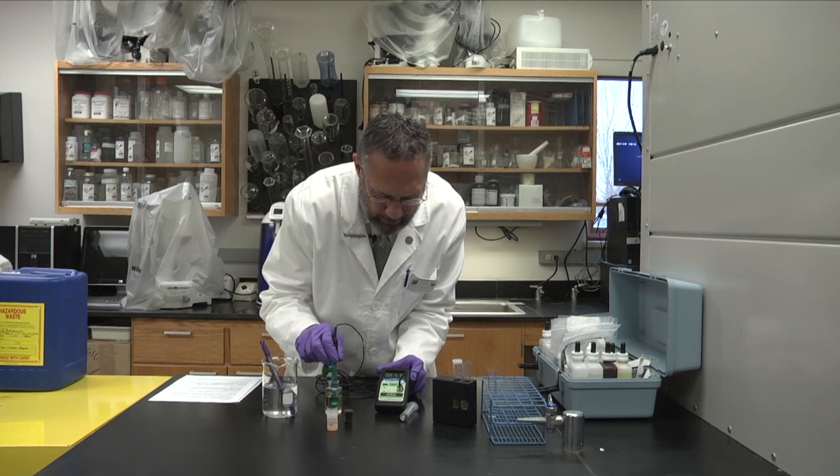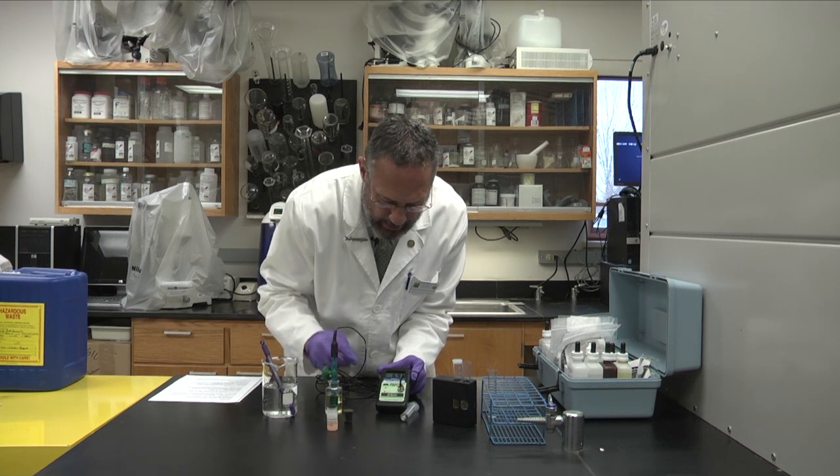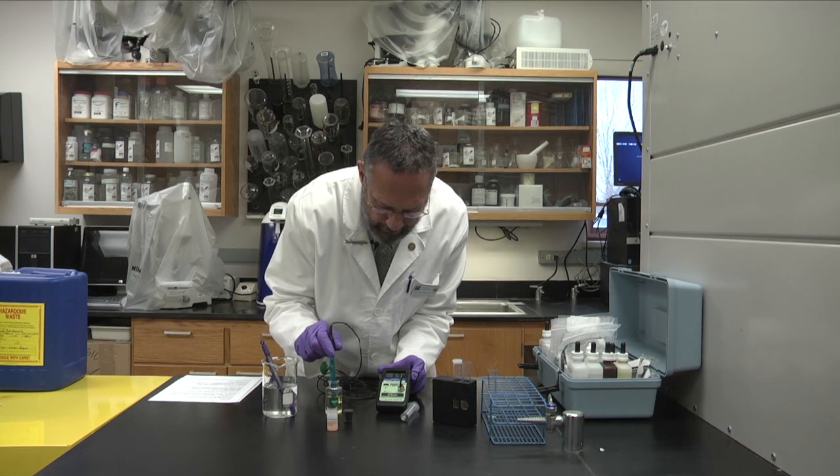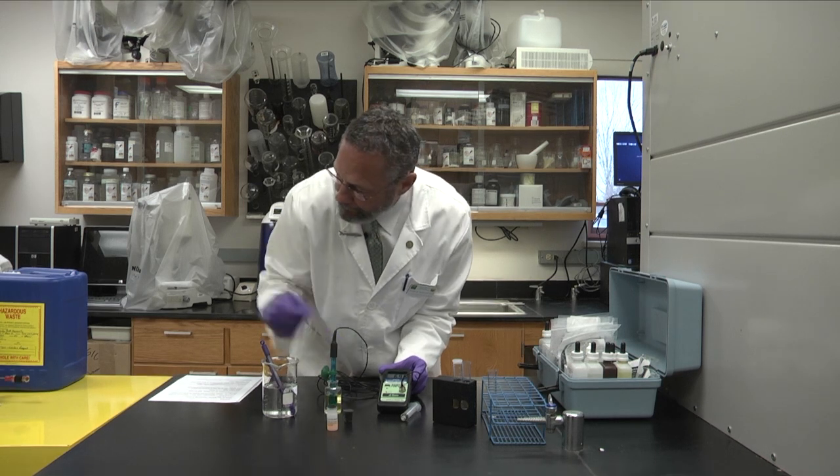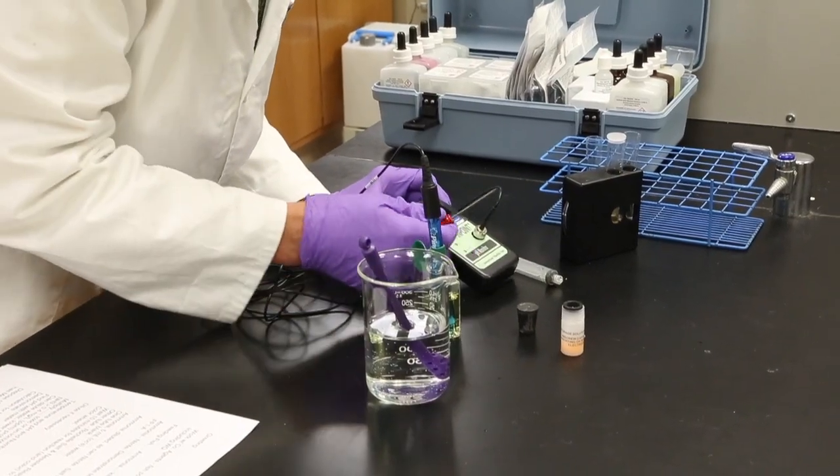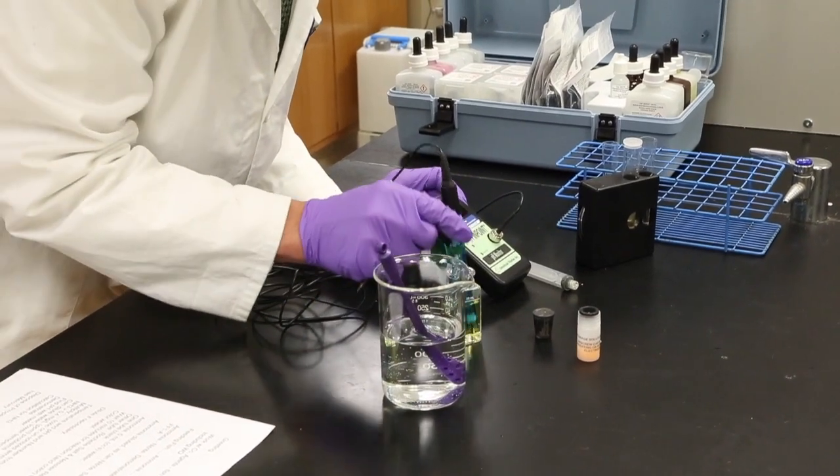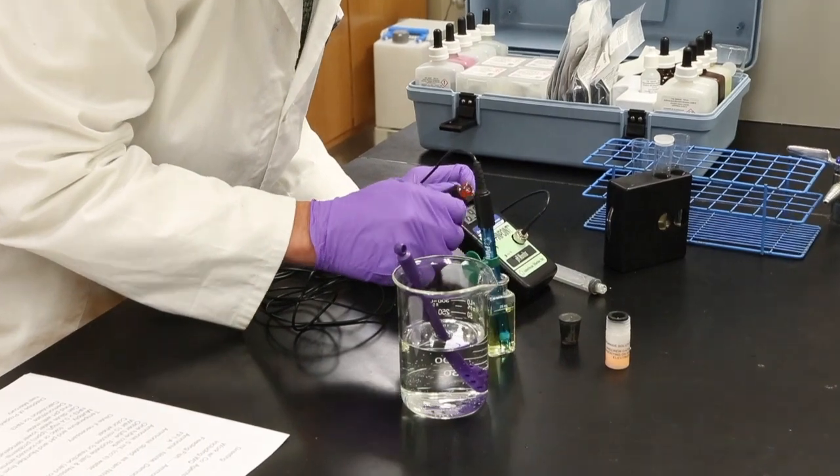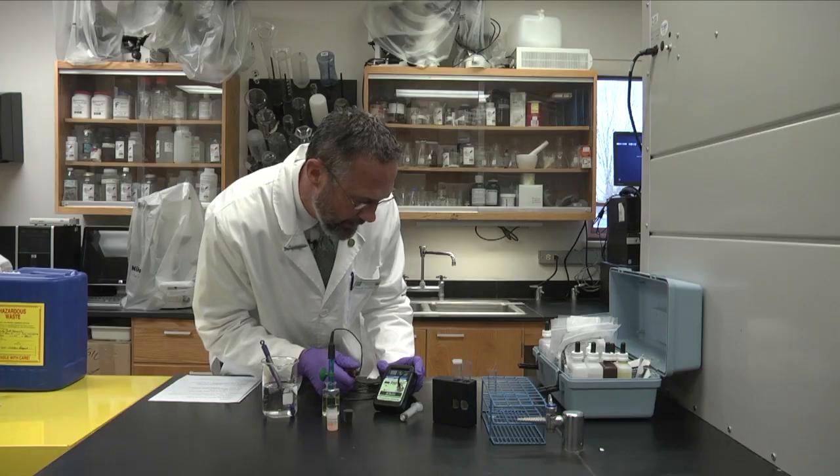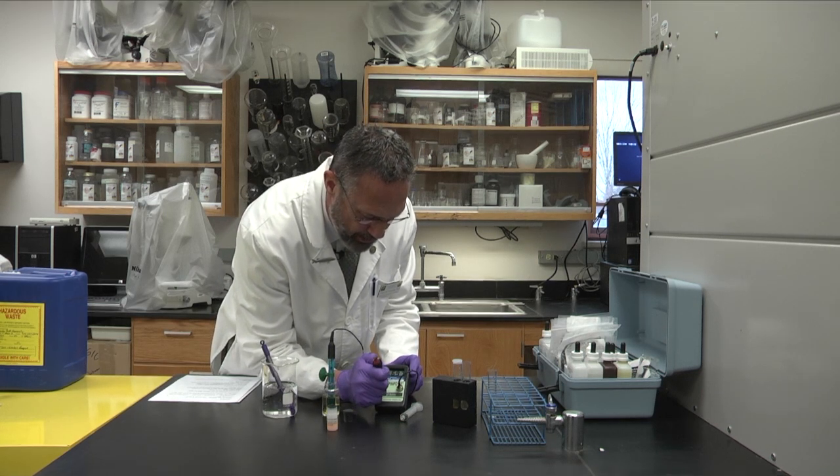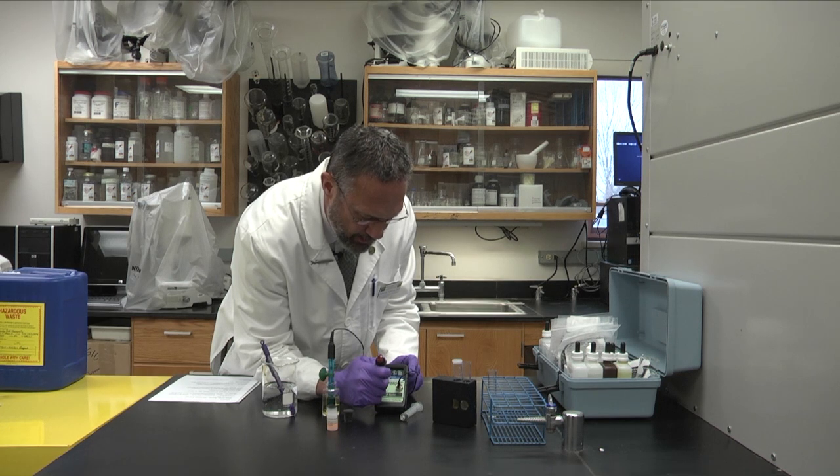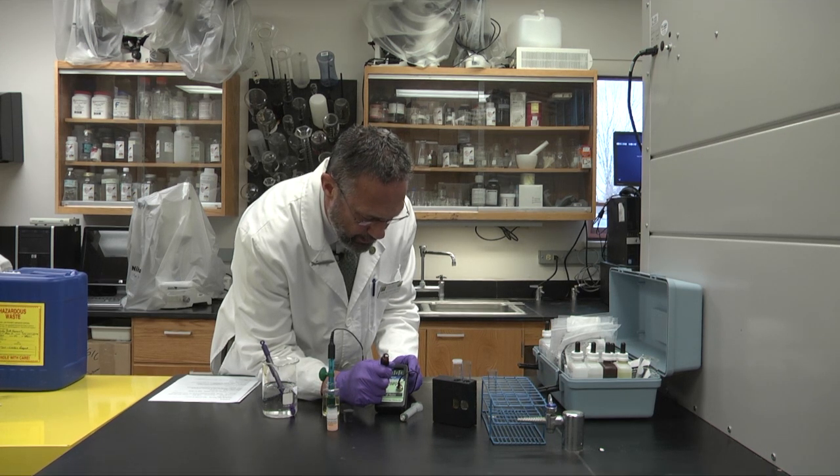And I find it helps if you move the probe a little bit and there's a little screw with the seven next to it right here and this will probably have to be adjusted slightly to make it seven point zero. We have to find a tiny little flathead screwdriver that fits in here and we're getting the reading of six point nine seven. That's essentially probably good enough for calibration but I'll just go ahead and show you that I can just turn this screw a little bit here and adjust it up to pH seven.